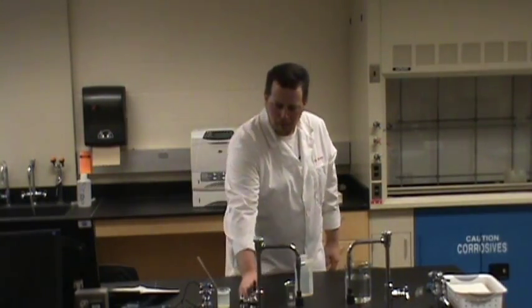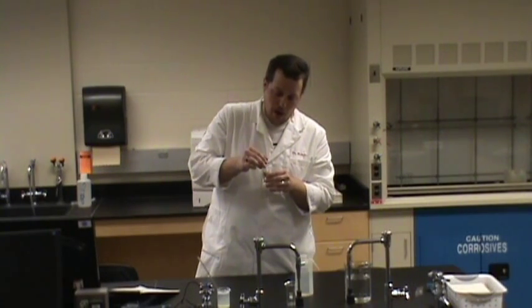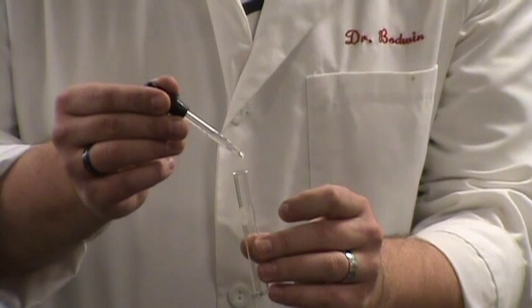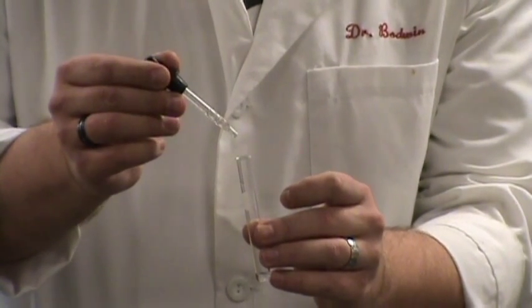The only other technique I want to talk about in the pre-lab is how to use an eyedropper. A lot of you will probably think you already know how, but unfortunately many will be tempted to not use it correctly. These dropper bottles have to be kept uncontaminated — if we start mixing the contents of bottles, everybody ends up getting bad results. That means if you want to add drops to something, hold the dropper above the mouth of whatever you're adding to, like a test tube, and add drops that way. That way you won't get contents of the test tube on the dropper.